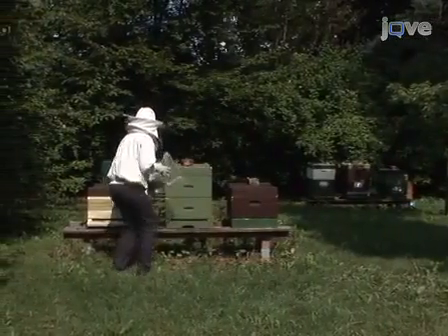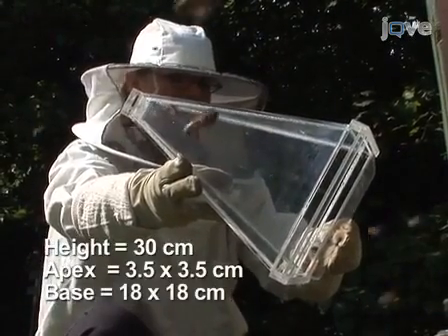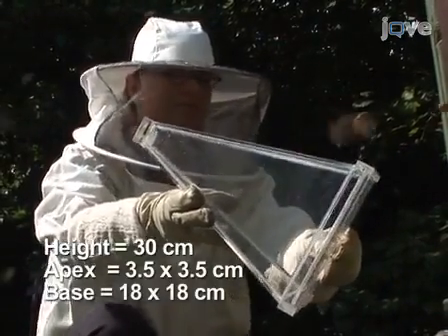On the day before the experiment, collect bees between 2 and 4 p.m. using a UV light permeable plexiglass pyramid.